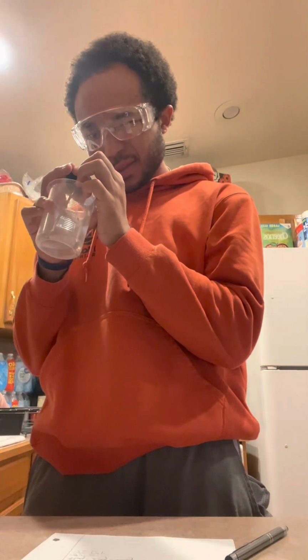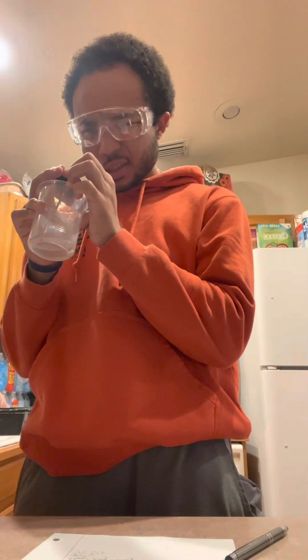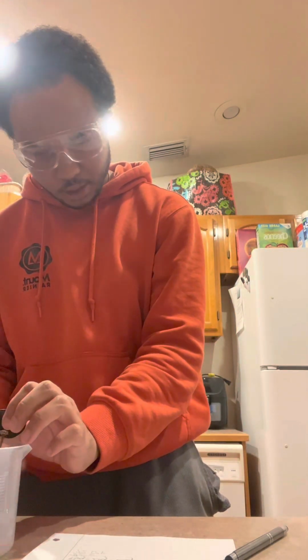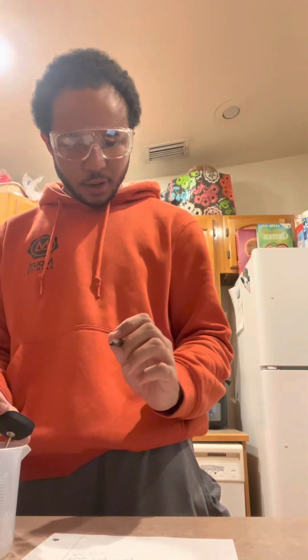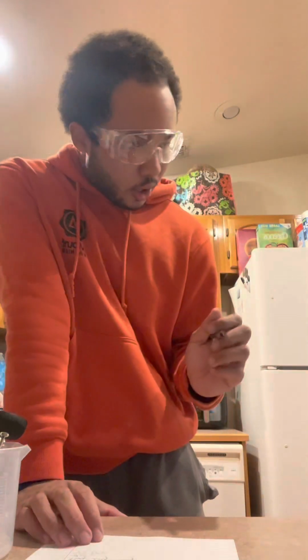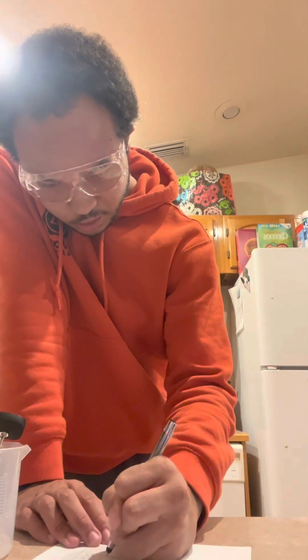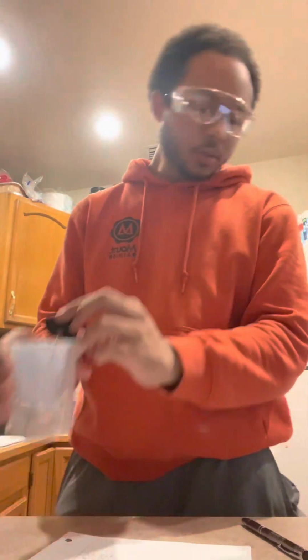So it goes up 2, so it's like 1, 2, 3, 4, 5, 6. Yep, so 6, and if we do that, it'd be about 72 degrees Fahrenheit. But using our significant figures, it would be 72.0 degrees Fahrenheit. But if it's looking for Celsius, we'll do Celsius too.